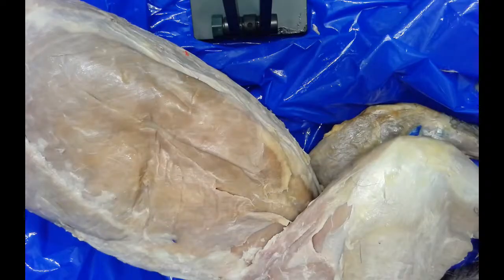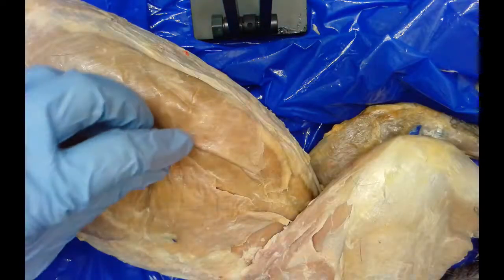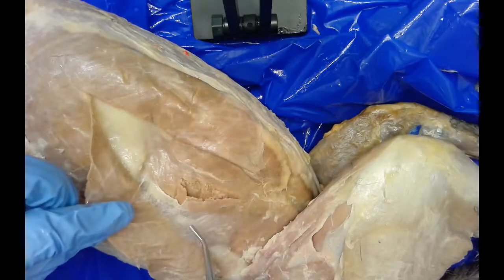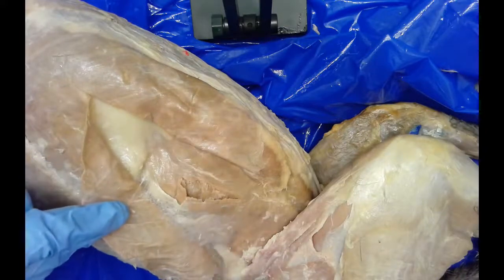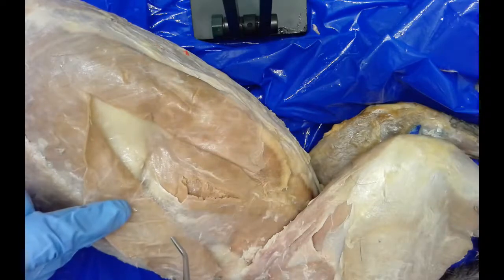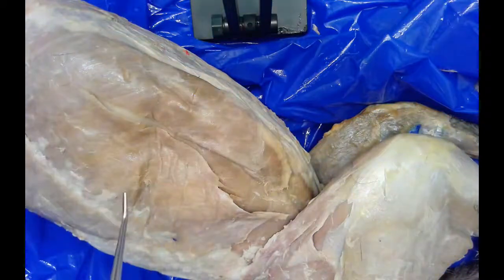We are focusing now on the muscles of the abdomen. One of the things you will notice as I'm lifting up some of this tissue is this kind of white webbing — that's called superficial fascia. It's connective tissue that's all over the body; it holds the fat onto the muscle and also holds different layers of muscles on top of each other. We want to first look at these abdominal muscles here.